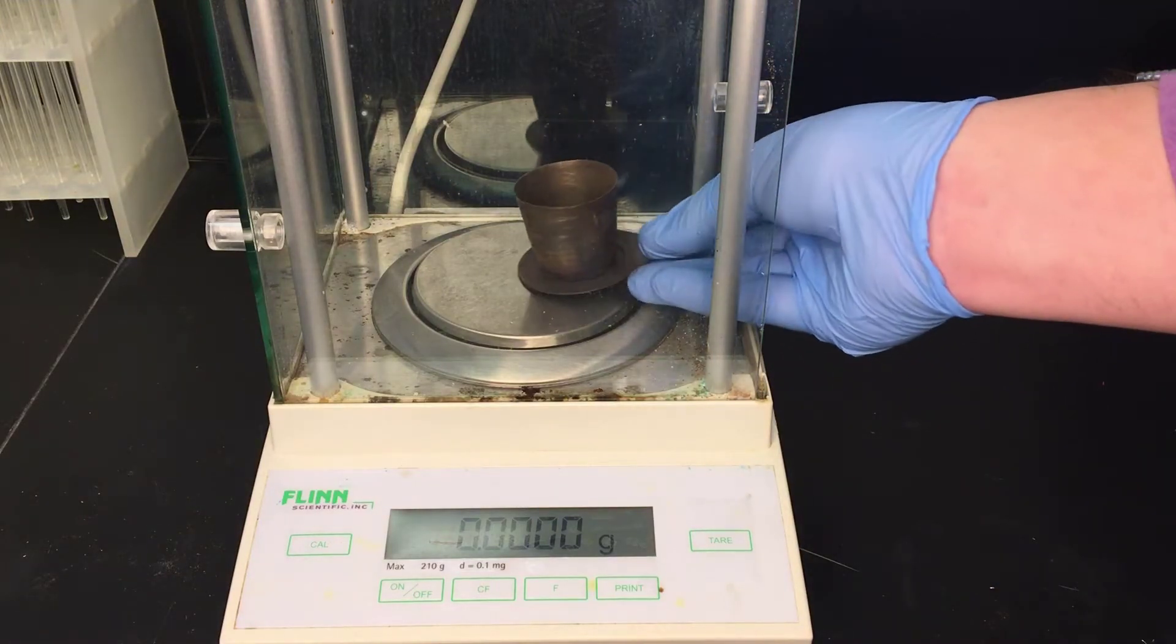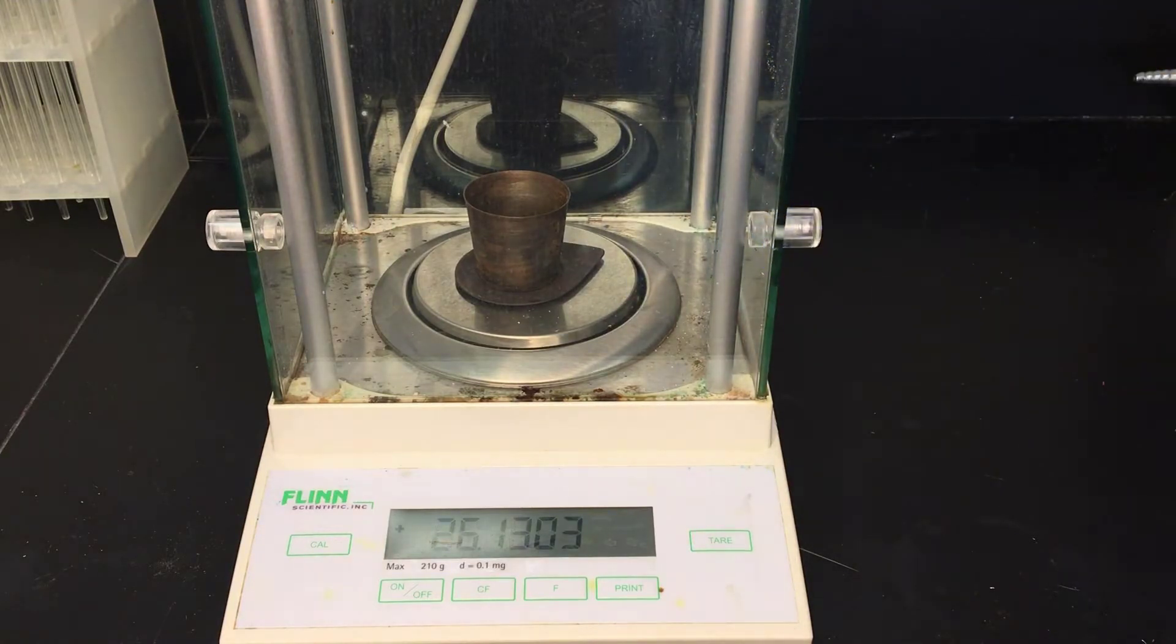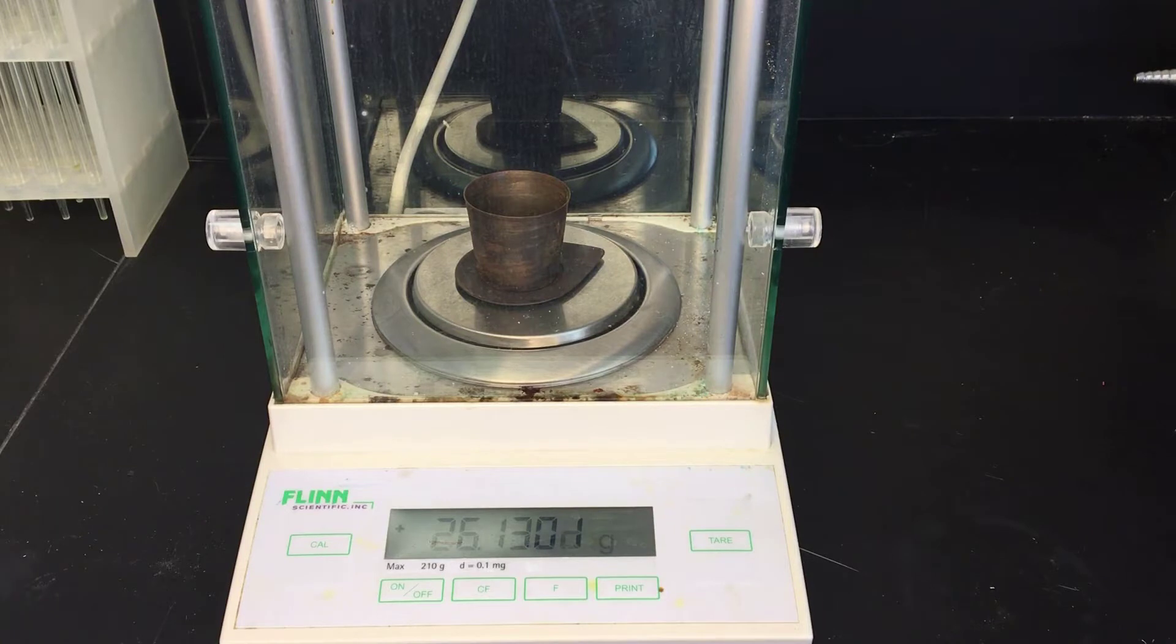For the hydrate labs, we need a hydrated salt. We're going to need a vessel to hold it. So we've got a crucible and a lid. We'll need its mass.